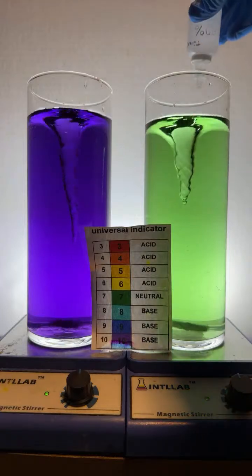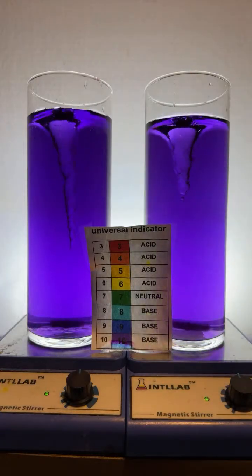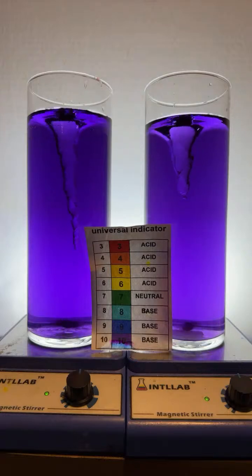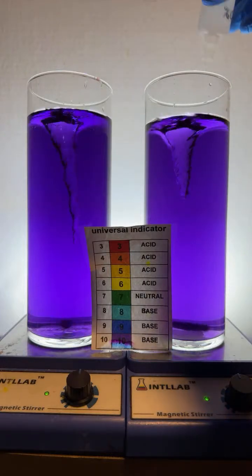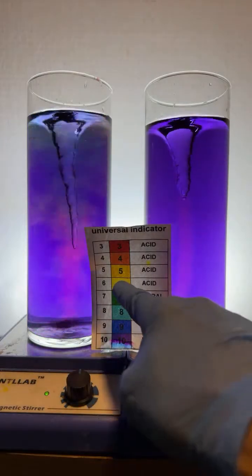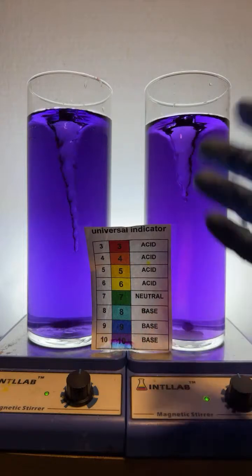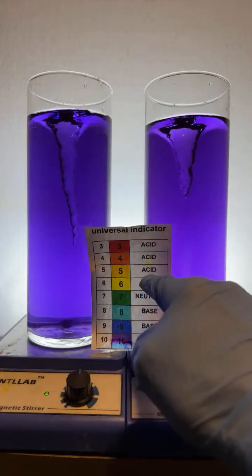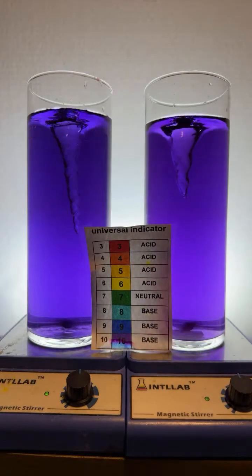So, water that has no color, we could test that. We would have to add the universal indicator. Universal indicator is a bunch of dyes, so we would add the system of dyes, all of the dyes, to the water. Usually when I do that, it turns the water yellow, because water has carbon dioxide in it if it's exposed to the air. And carbon dioxide makes water slightly acidic.